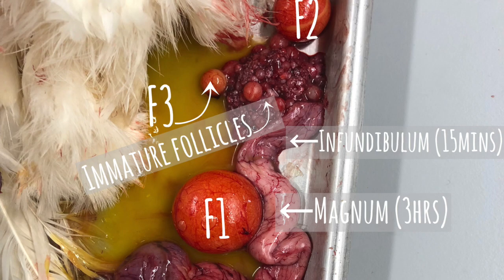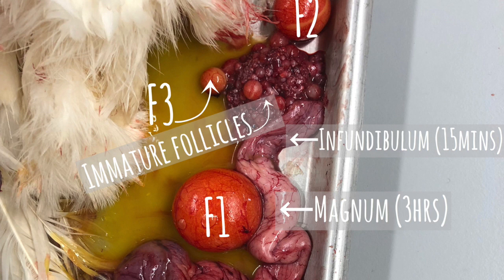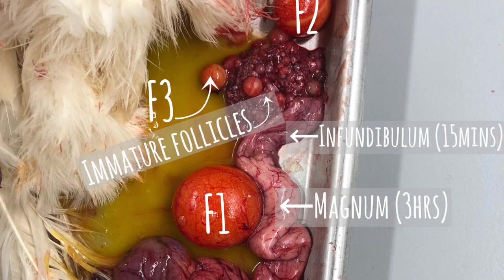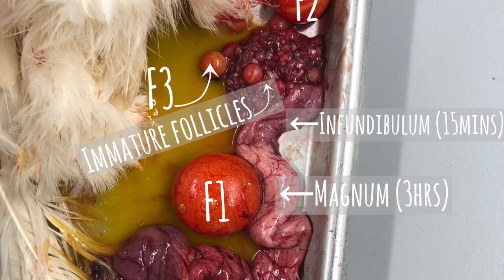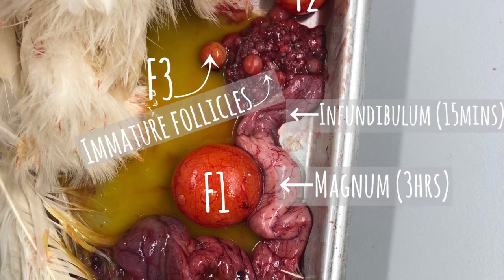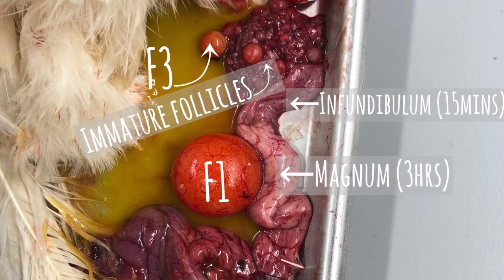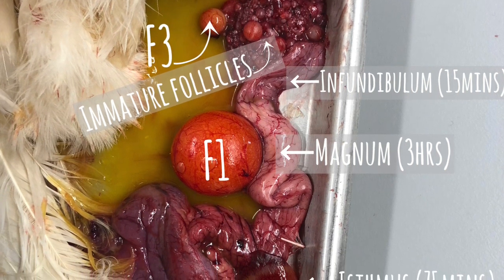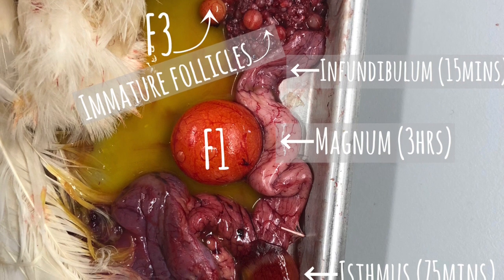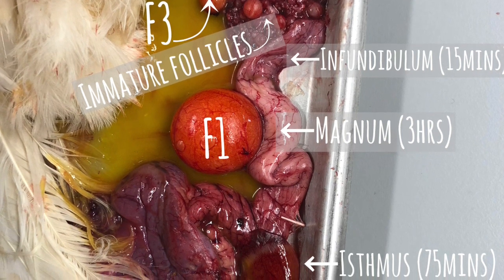balance. As for the reproductive system, Nugget is a female, and in chickens, only the left ovary and oviduct fully develop. Immature ovaries are red and small, and mature ones show large and small yolky follicles. Follicles are labeled as F1, 2, and 3, and there are small yellow follicles that replace white ones. Post-ovulatory follicles remain after ovulation. The stigma is the non-vascular area on the follicle and is the site of follicular rupture during ovulation.